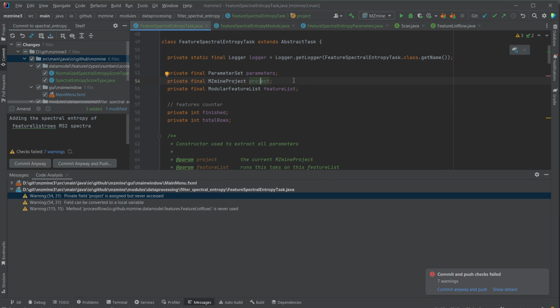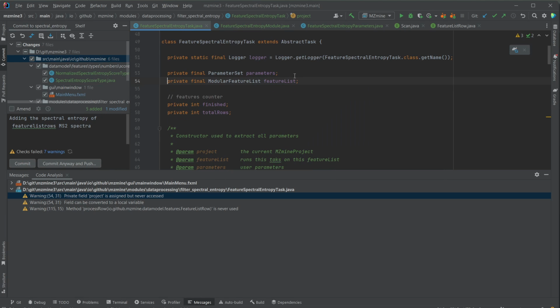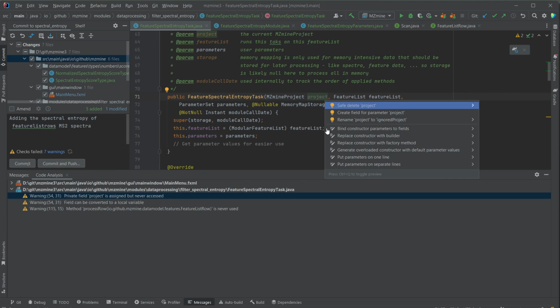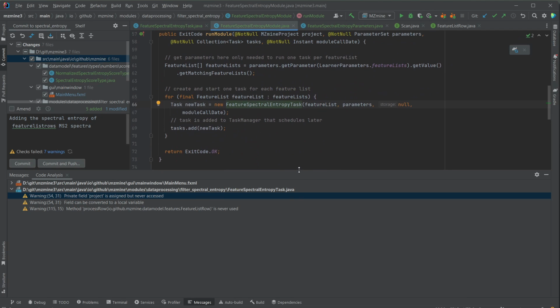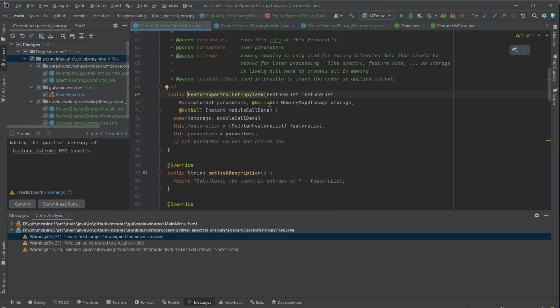If you see a gray field here, I can just Alt-Enter and then remove the field, which is, I think, very reasonable because in this task, we're not going to work with the project either way. We just work with a feature list. So we remove it, and we can see how it's also being removed from this method signature, or from inside the method. But we can also remove it, safe delete project from the method signature, and now it's removed. And also in the module where we create the task, it's also removed. So if we do it this way, Alt-Enter and Safe Delete, we don't have to worry that much that we forget any instance where it's still used and needed.